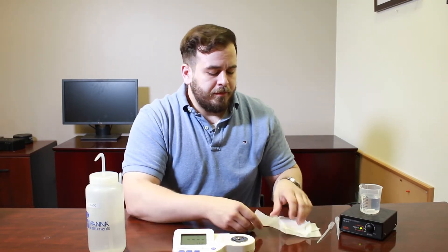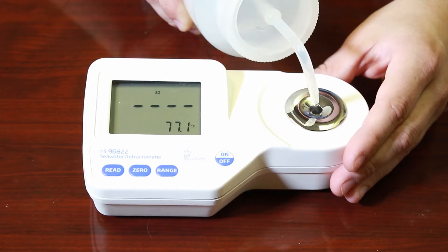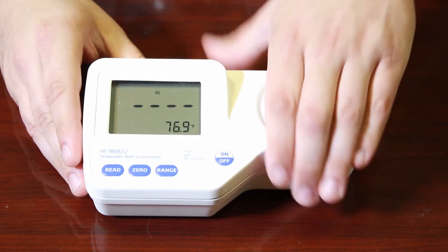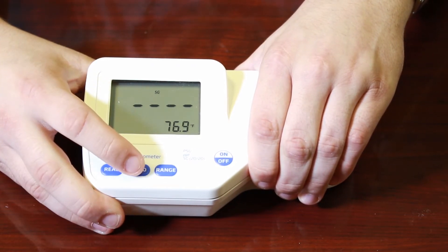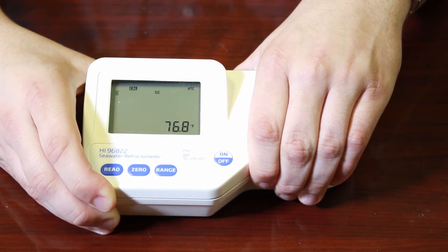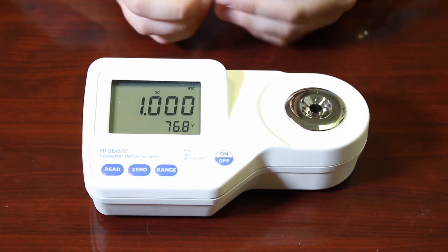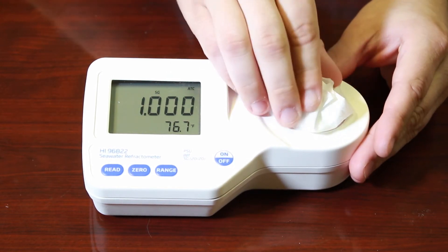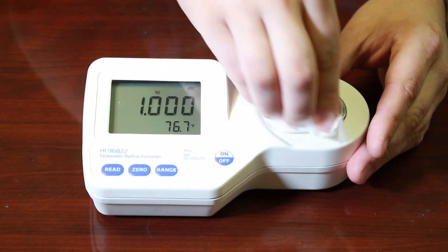To run a test, it's super easy. I'm going to add some deionized water right to the plate — just fill up that entire black well and make sure there are no air bubbles. Once it's filled up, cover the plate with your hand to block any external light sources from reaching the optical sensor, then hit the zero button. It will flash, and the meter zeroes out to give you your first reading — the meter is now calibrated. Then gently take a kim wipe or soft tissue to absorb the water, being careful not to scratch the glass or damage the optical sensor.